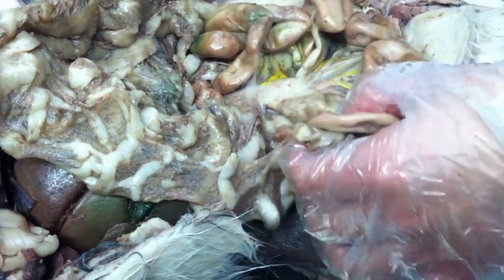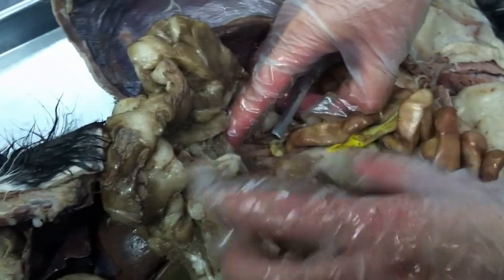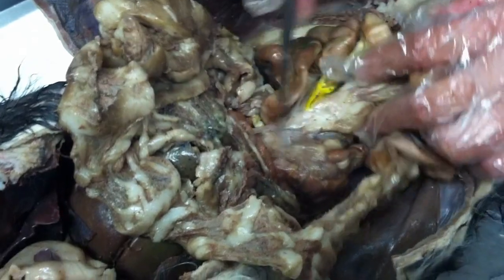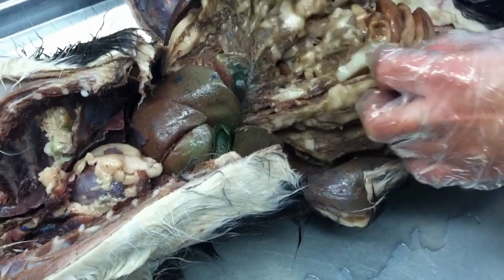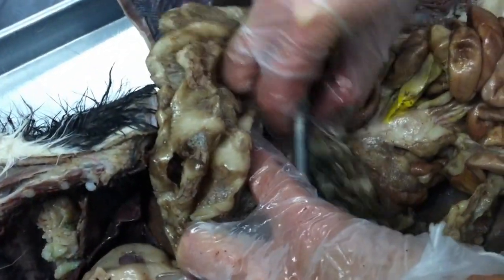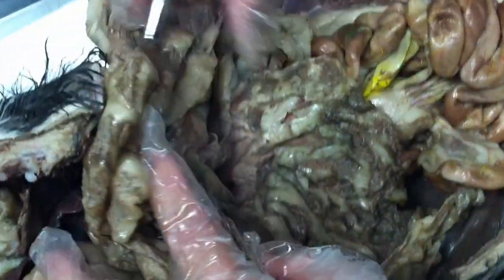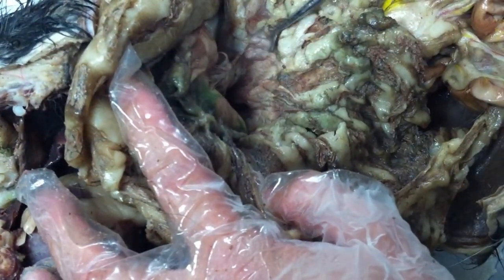And here actually you start to see the portal veins and some duct. See if you can dissect that out and follow it a little bit more. We still have the pancreas. Where's the pancreas? It should be behind it. Yeah, you see this one? Pancreas. It's really hard to find in the cat.